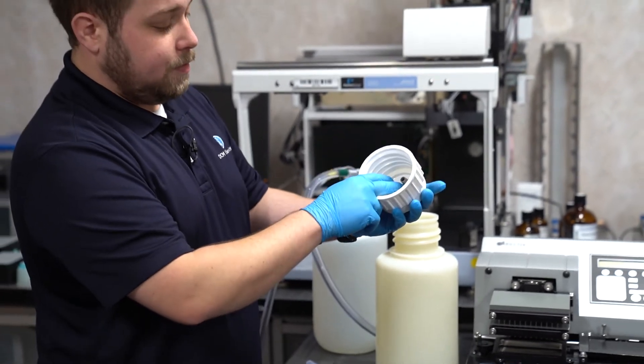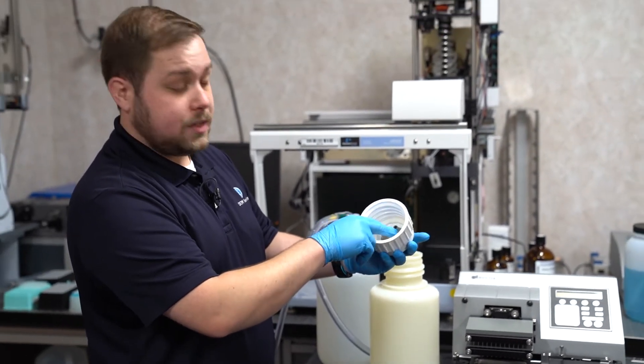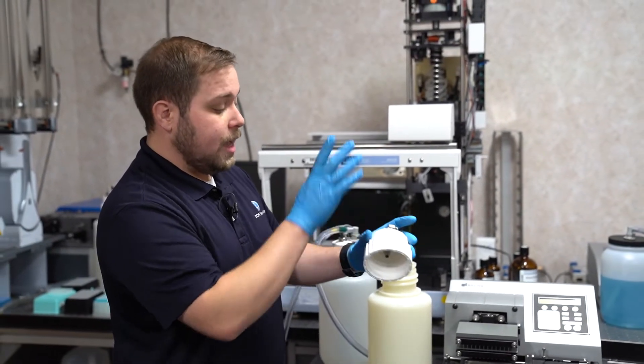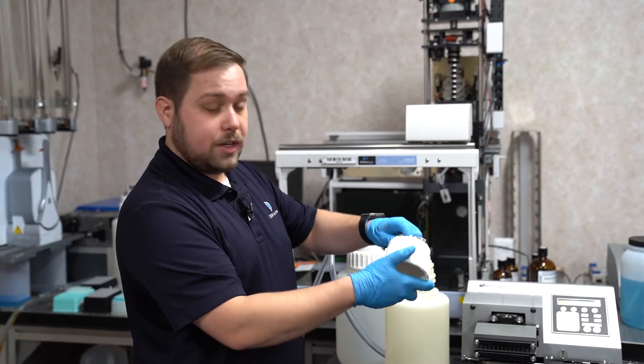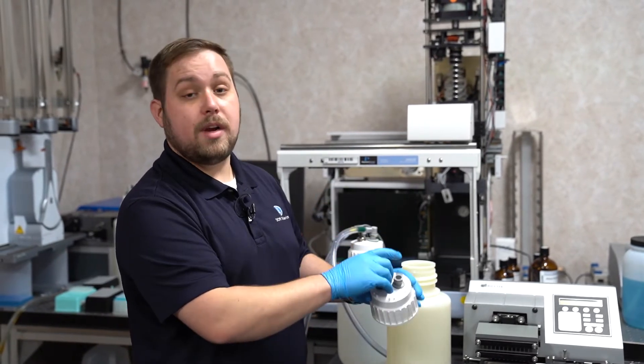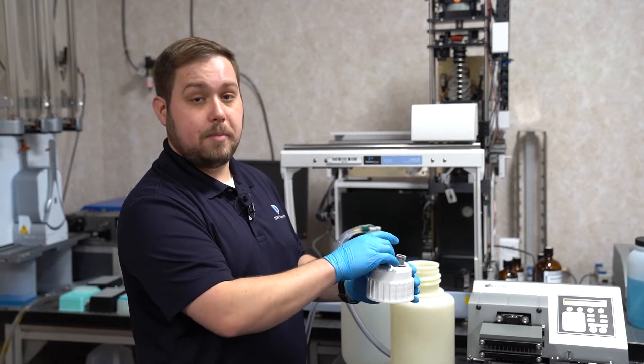From the underside, we want to inspect the female fittings and make sure there are no cracks, no visible damage, and if we notice a little bit of motion on the top, we want to tighten that down. Depending on the generation of the fitting itself, that method will be different.